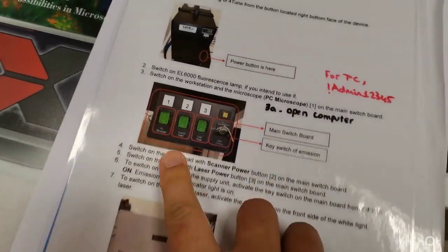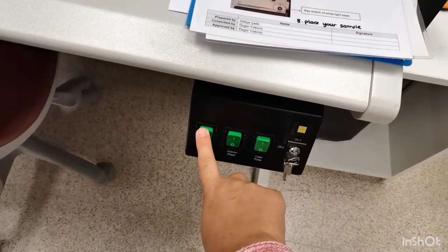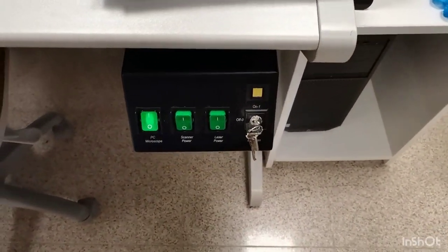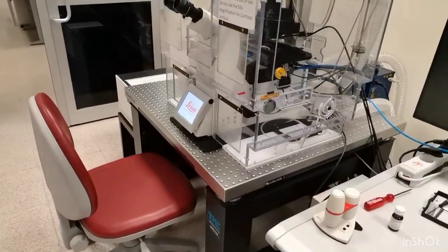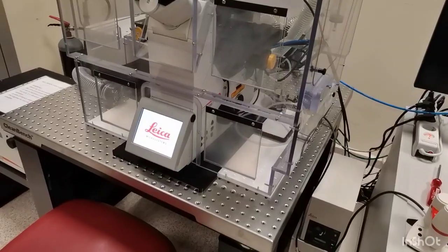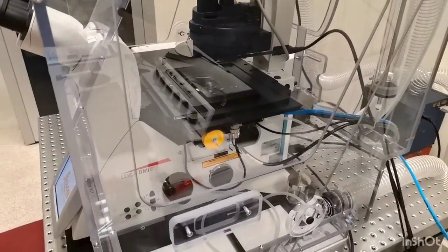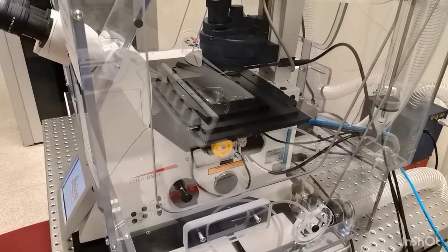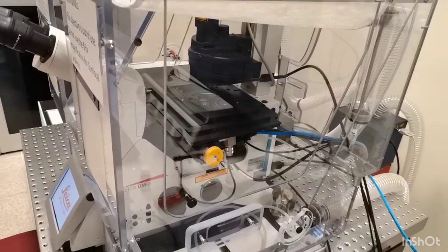When we press the first button, the microscope starts working and it arranges the stage. So the stage must be empty of any samples and the objectives must have been left at the very lower level, so that the stage does not hit the sample or the objective, and so that we can prevent injuries to the system.